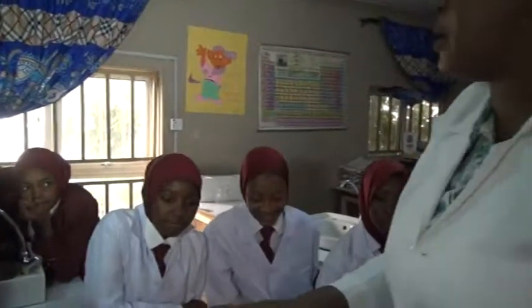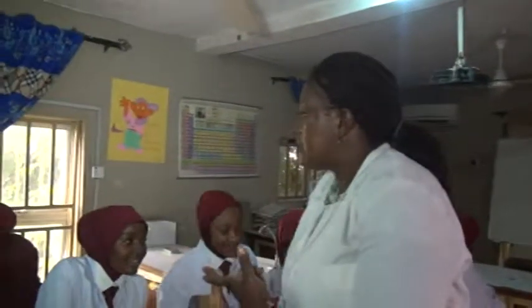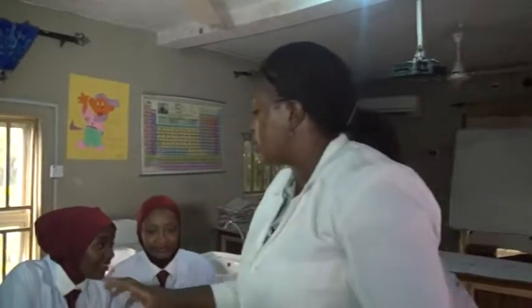Now you conduct your own experiment. I'll also label them like this and put them, so you are going to identify which one is your acid and which one is your base. Do you understand what we have just done now? Yes. Thank you very much.